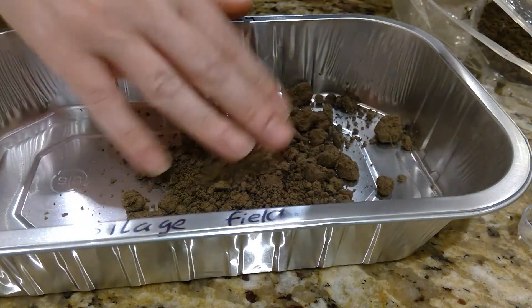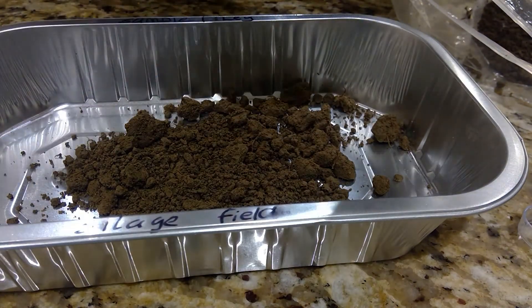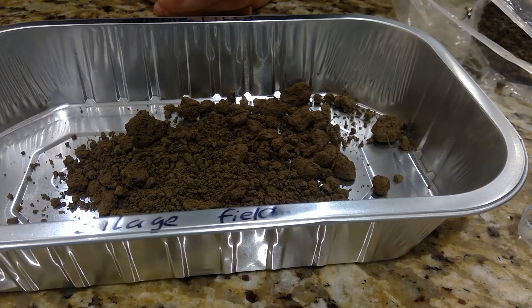Most of it's gone — negligible — and I'm going to put it into an oven at 105 degrees Celsius. I like to leave it in there for about 10 minutes initially.